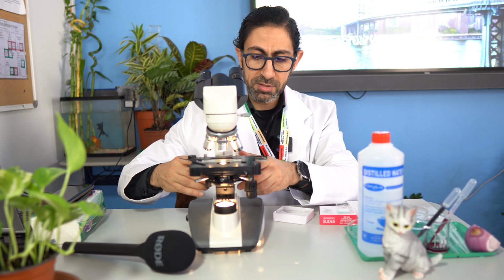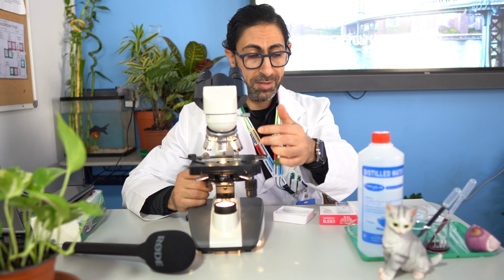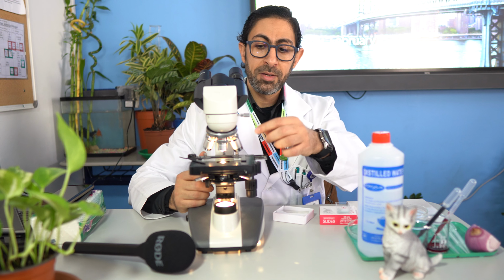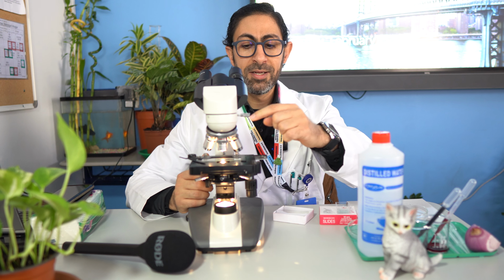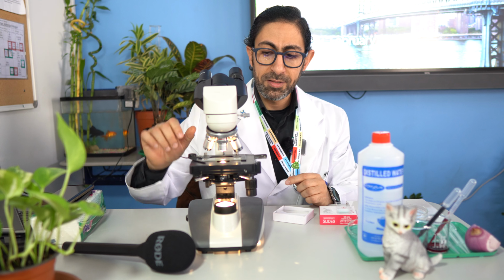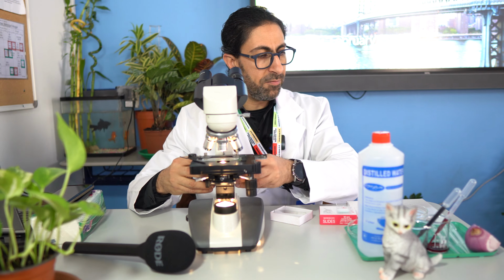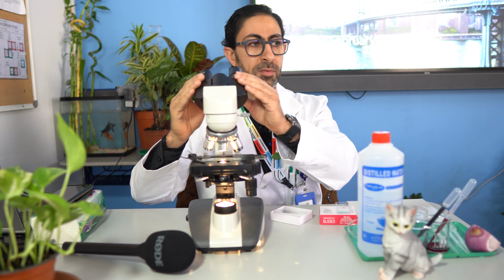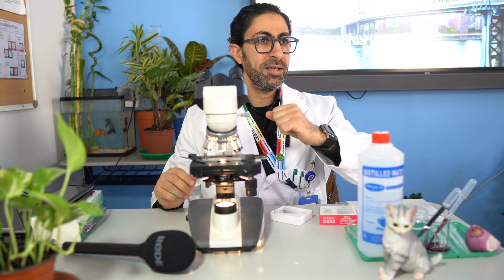This is one of the tricks that you have to be sure of. Why? Because if you do this using another lens, you may break the slide itself. So now the specimen is on the slide. The slide is mounted on the stage. The stage is secured by the clip. The coarse adjustment takes the stage to the highest level. Afterward, you will examine it using the eyepiece. The eyepiece itself has an eye lens.